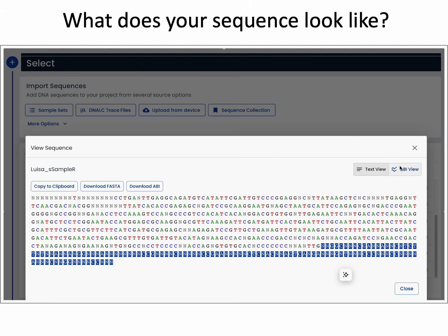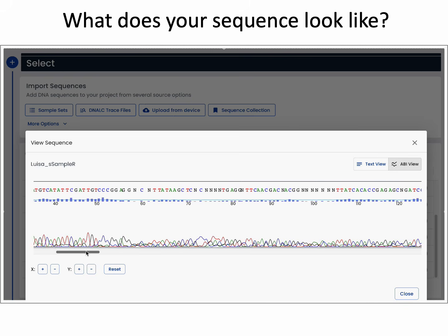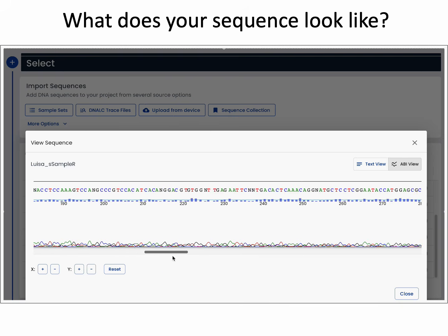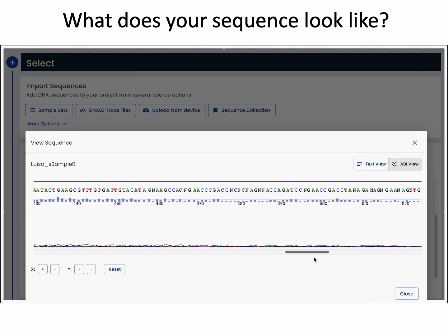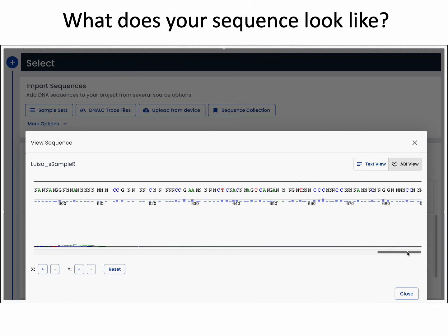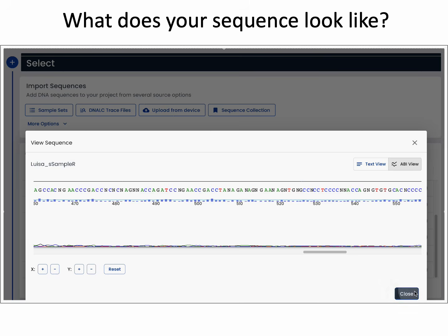Let's take a look at the AB1 view, and what you'll see is the waves of the sequence at the bottom are all garbled, overlapping each other and not clean. And the individual purple bars or Phred scores for each of those calls rarely pass that Phred score of 20 threshold. And so most of these calls are low quality calls that can't necessarily be trusted.